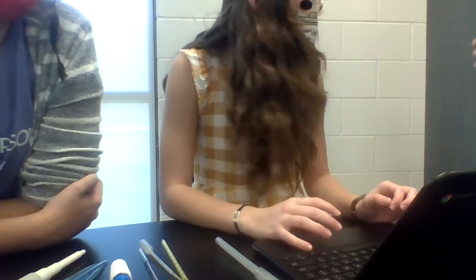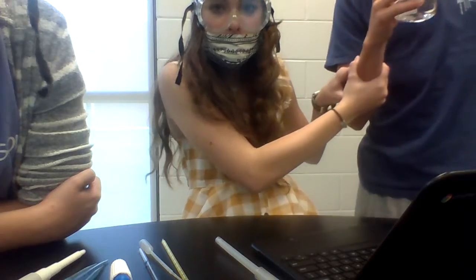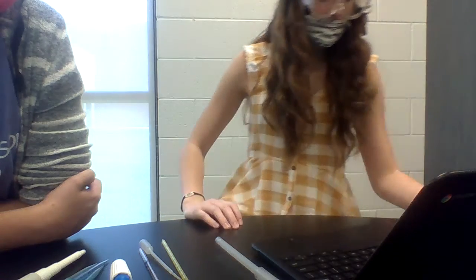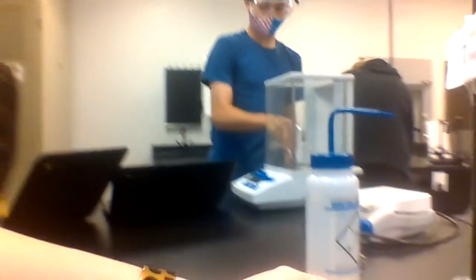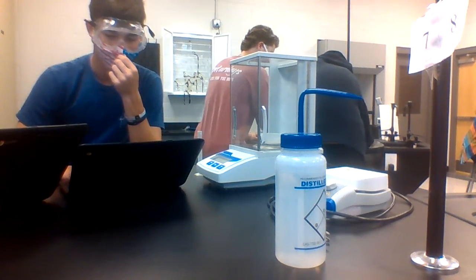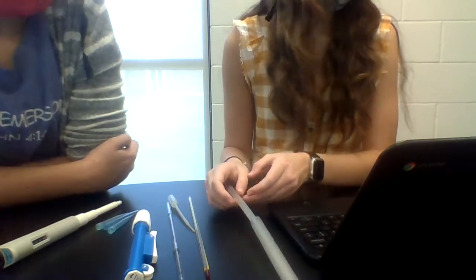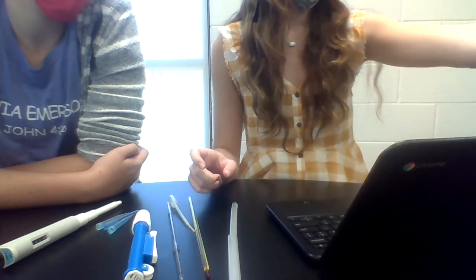Alright, now we gotta add another milliliter. Wait, you gotta do it so the camera can see it. That's about good. That was good. Okay, we're putting it into this one. Make sure that y'all are in Word document. Make sure you hit file, save as Google Doc. I'm just showing what we're doing. Now what did it measure? 0.8751 grams. We were close.